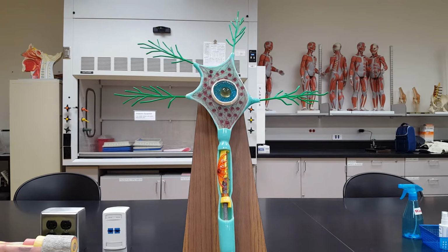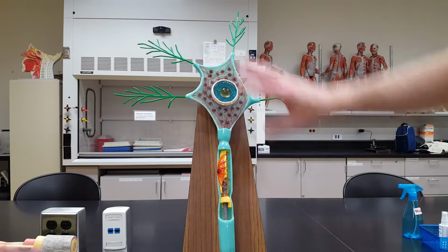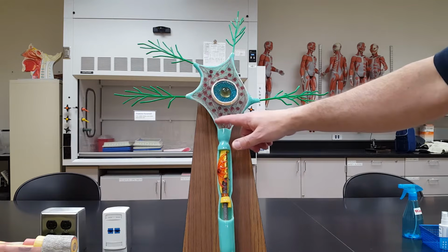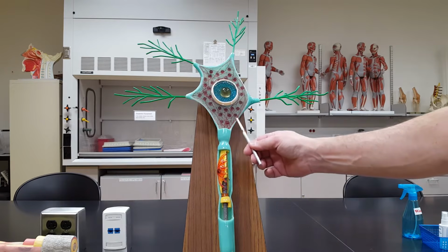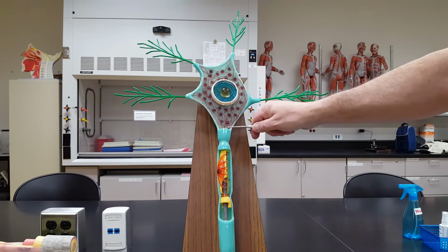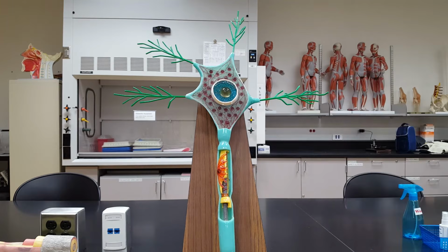And what you can see right here, follow my probe around and we will zoom in a little bit, where the cell body narrows down to become the axon, we have a small, in 2 dimensions, triangular looking bit of the cell. In 3 dimensions, it's actually a cone. But right here where the cell body narrows down to become the axon is what's called the axon hillock.